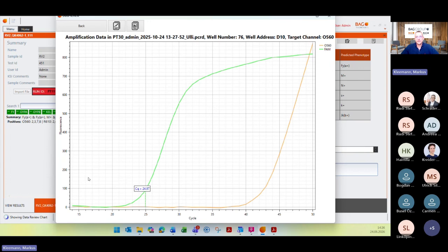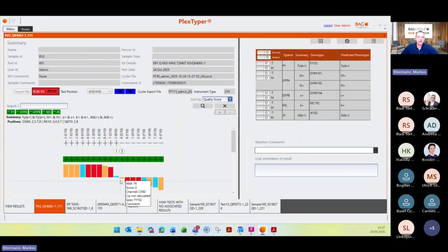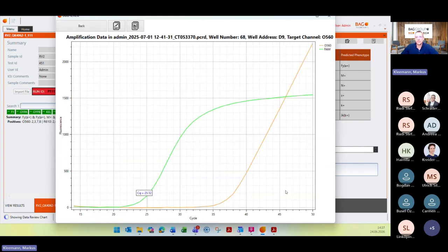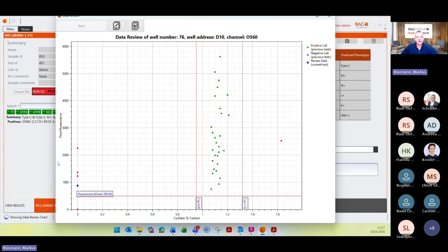When I double click on this, you can see that there is no CQ calculated for your target curve. You see that there is a really late increase, I think after 39 or 40 CQs. And this is like a strong increase here, which we sometimes see, which is a classical artifact, or which maybe is based on primer dimers, so that the reaction is over here. So we also have some of the reactions which we call a road runner, which go over here and move to this area. So for example, this one looks basically like the same one. So PlexTyper calculates them correctly as negative ones.